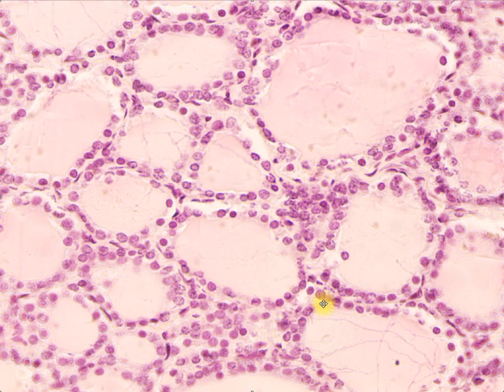And here on the other side is another layer of simple cuboidal lining epithelium, wherein again, since this is the lumen, this will be the apical surface of your cells, and their basement membrane is also somewhere here.